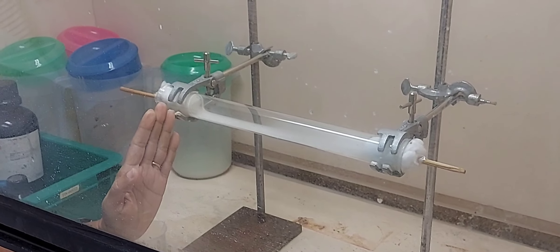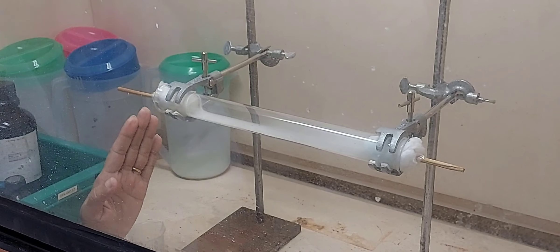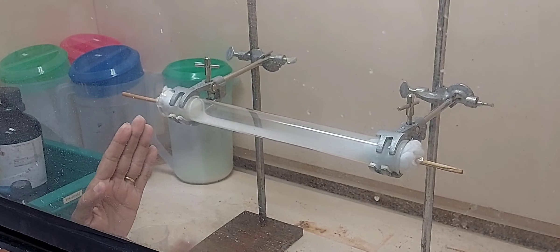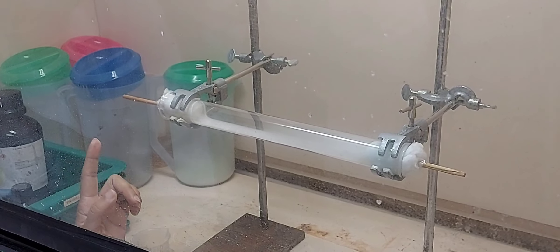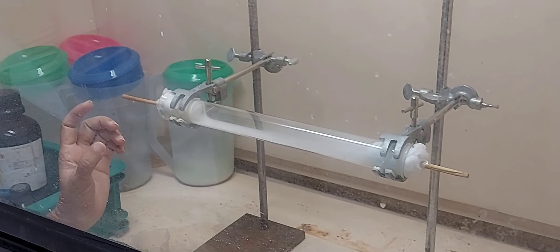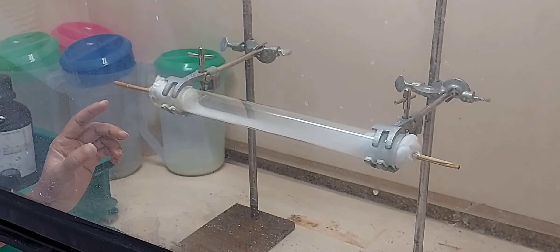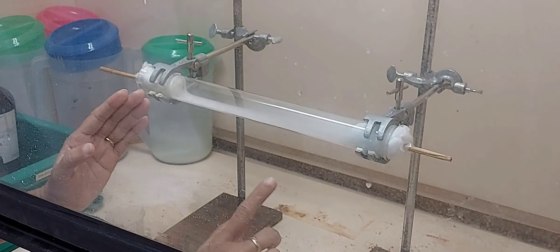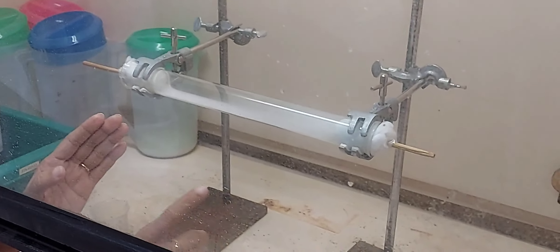You saw it here, isn't it, first. That means ammonia has traveled faster than HCl. HCl vapors are more dense, so it will be moving slowly and ammonia is less dense, so it has moved faster.